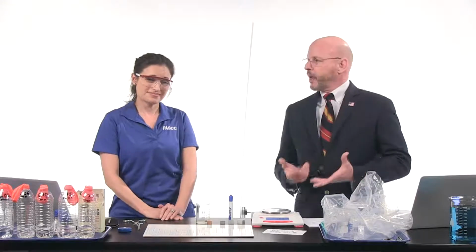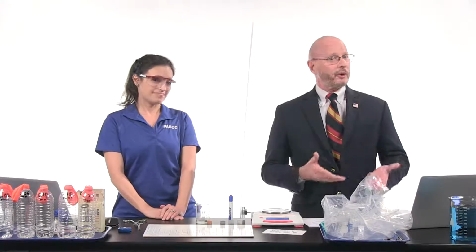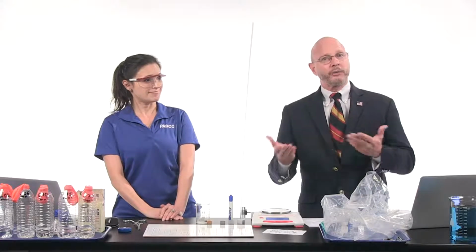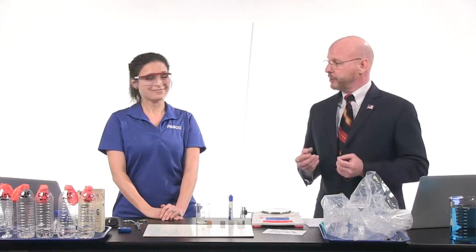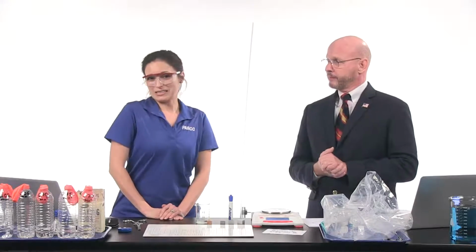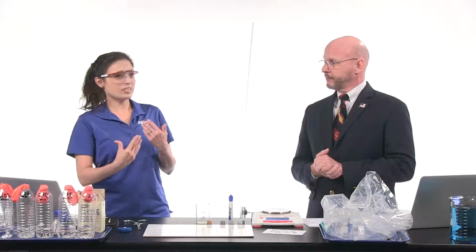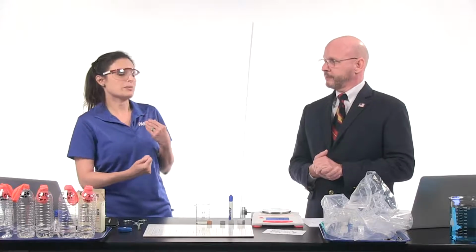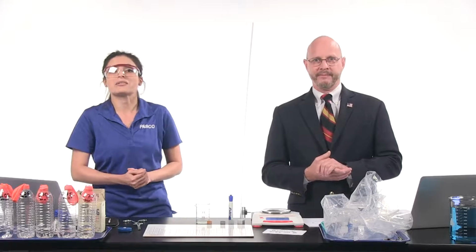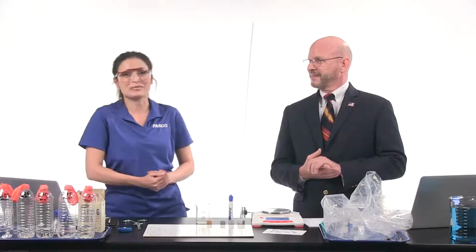So when you say reactions, and of course we know chemistry is all about reactions. Everything that we do in chemistry is reactants, products, and that ability to measure those really comes down to the mole concept, doesn't it? That's right, and so grams, moles, all those conversions that you do, we've got some great demos to show you things with the balance, things with sensors, and ways to count without actually counting out individually 6.02 times 10 to the 23rd things.